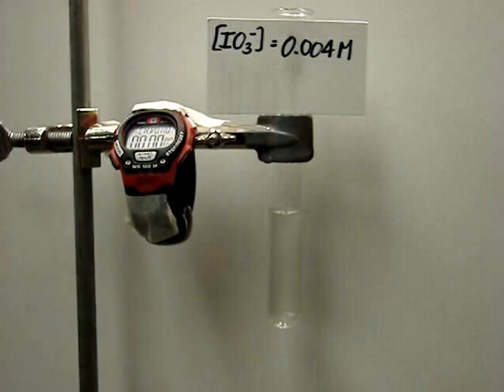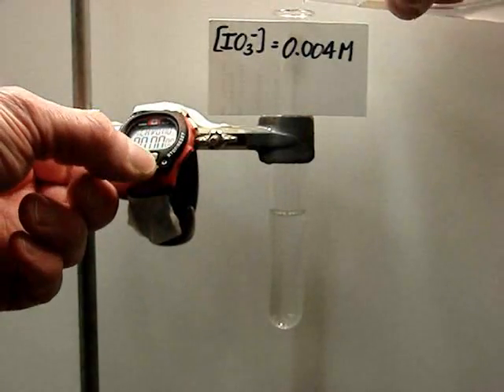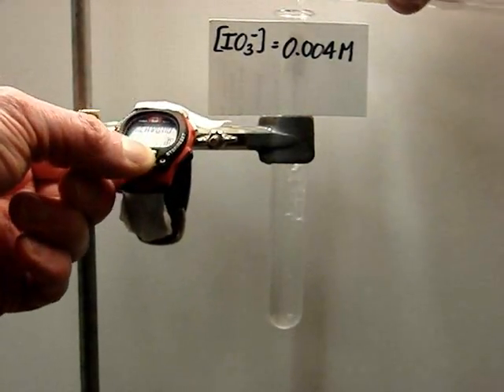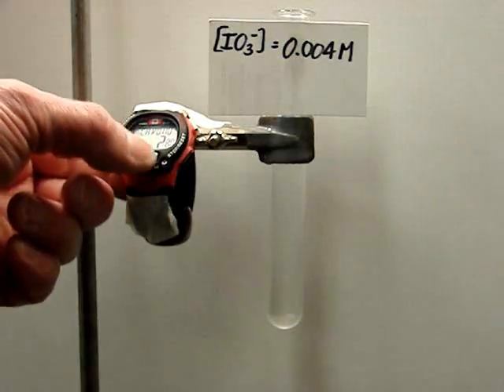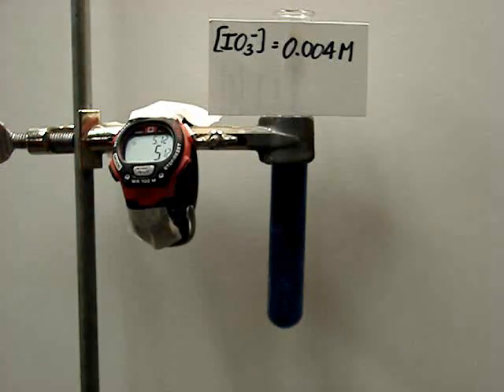This time we'll try 0.004 molar. About 5.12 seconds.